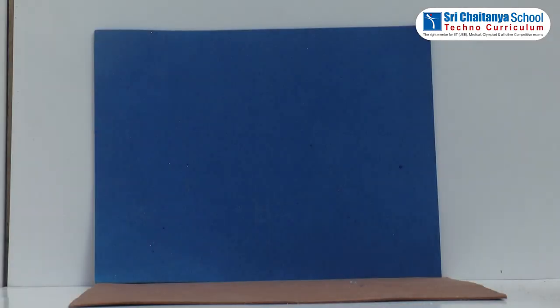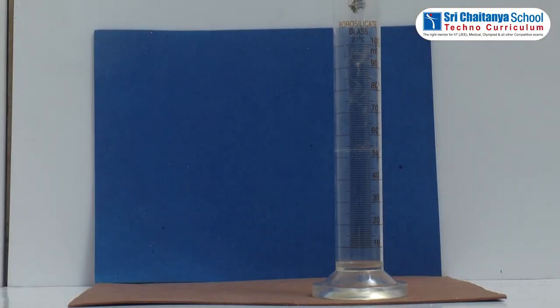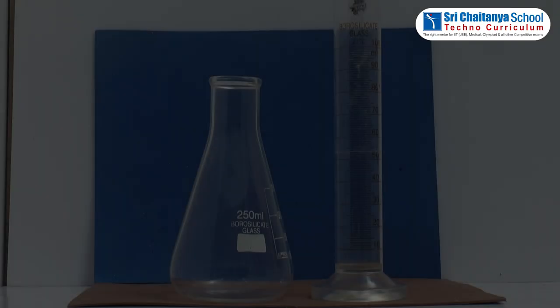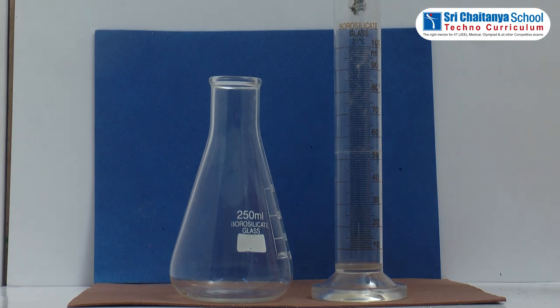Now we continue the same process with another liquid — milk. Take some milk in a container using a measuring jar.